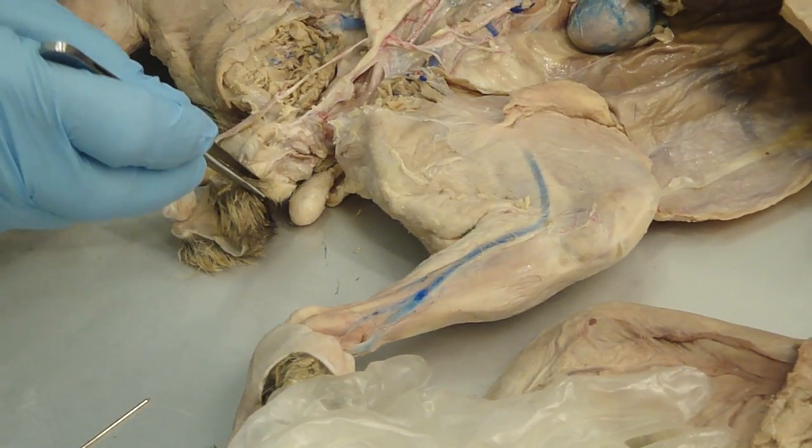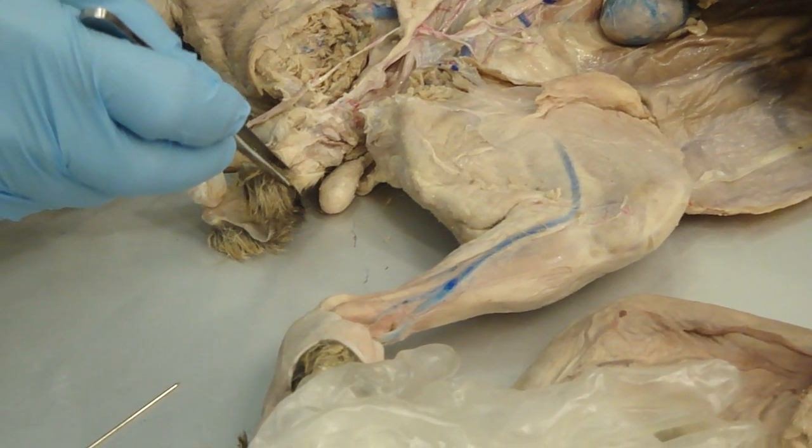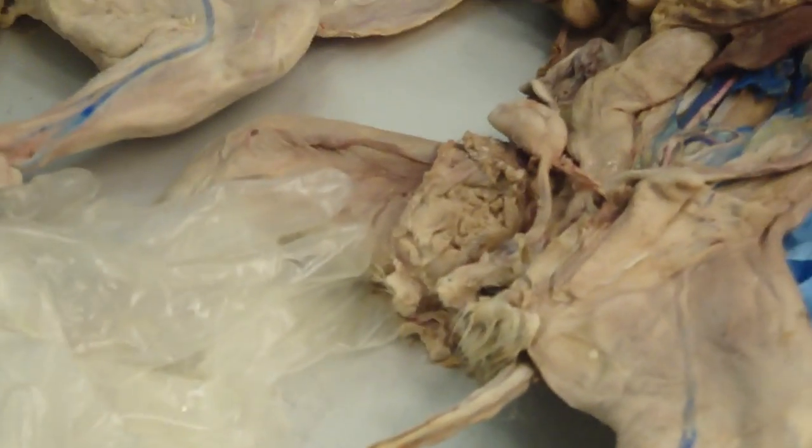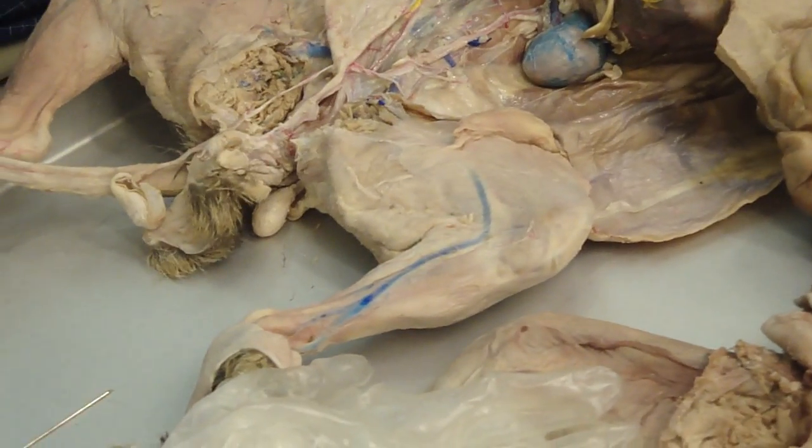So you guys in the vet business, males normally bigger? Ah, okay, that solves that problem. You just thought we cut it off by mistake. So it's much bigger here in the male than the female.